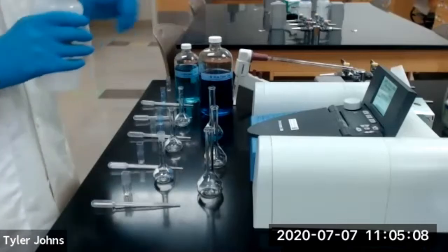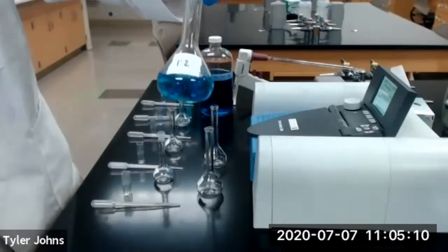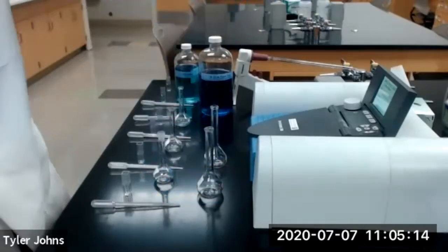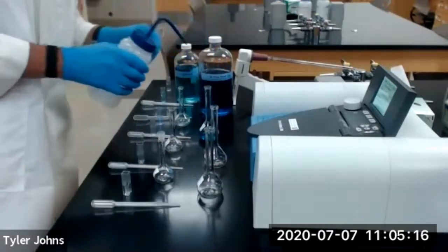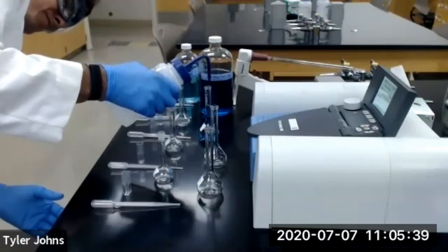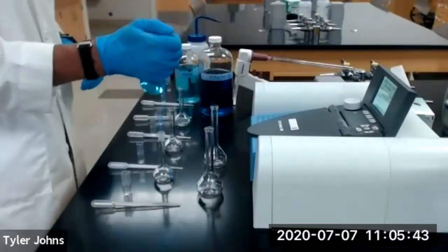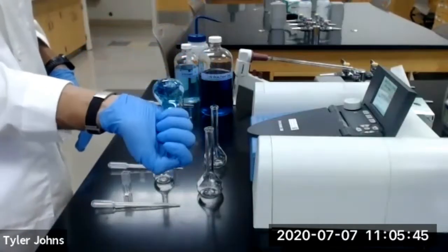We'll then fill our 50 milliliter volumetric flask with deionized water. And we'll invert to mix several times.